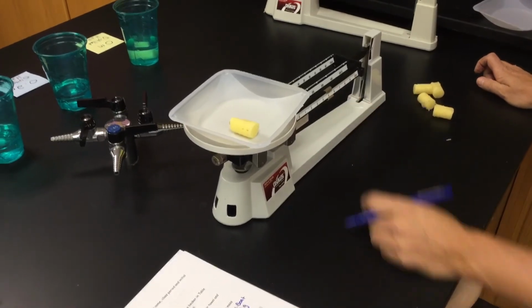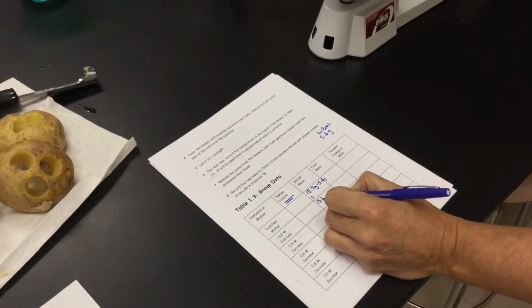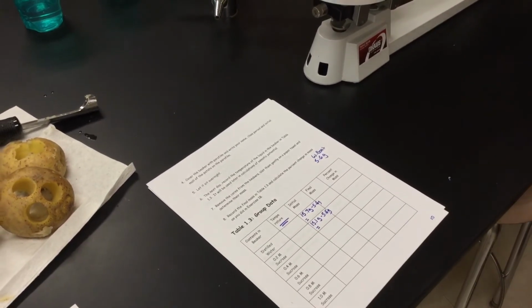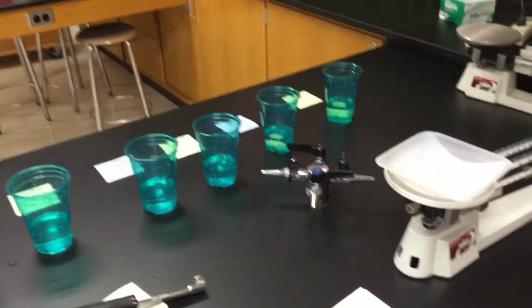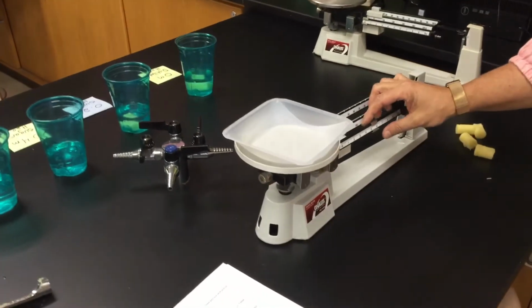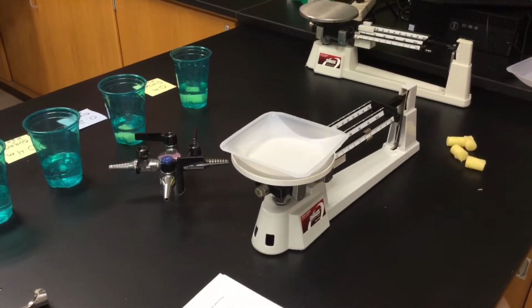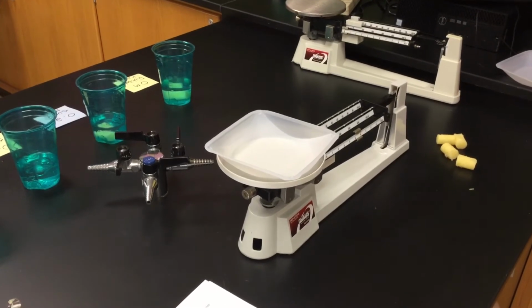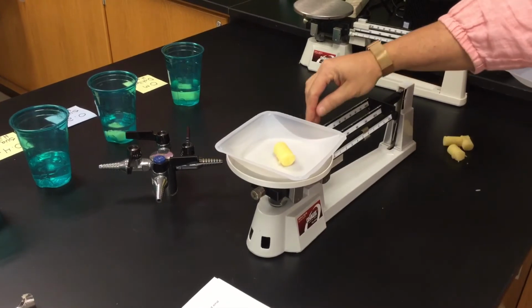Let's go 15.1. It's 0.2 sucrose. We're going to go 15.1 grams. We have to subtract out our 5.6 grams for the weigh boat. That will give you your initial mass. This one is going to go right into my 0.2 molarity solution. Going back, we're doing it again. I want to recheck that weigh boat each time because you're going to notice there's a little bit of potato juice left in there. Not enough to change my mass yet, which is good. Next one's in.